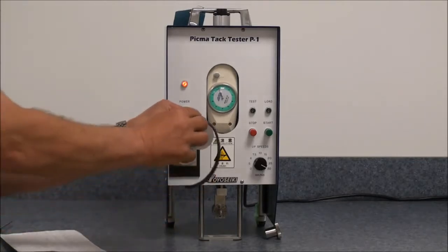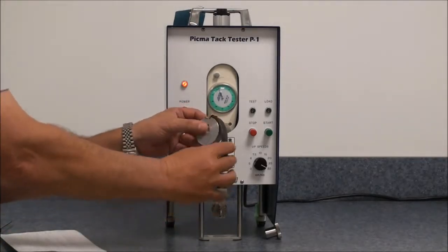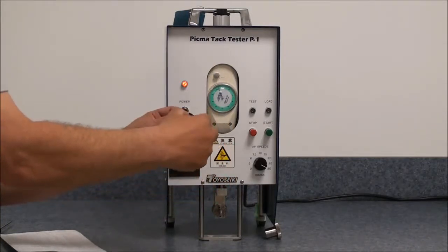The sample goes in one of the little holders, goes around and put into the next holder.